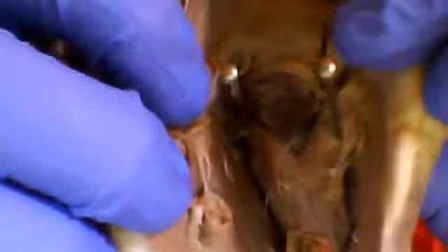And so the superior and inferior vena cava, in addition to the coronary sinus, which is this area that I'll point out right here. There we go. That is the coronary sinus down in there. These all carry blood into the right atrium. These vessels are all veins, and the blood that they carry is deoxygenated blood getting back into the heart, ready to be oxygenated. We're going to stop the video right here, and we'll record the rest.